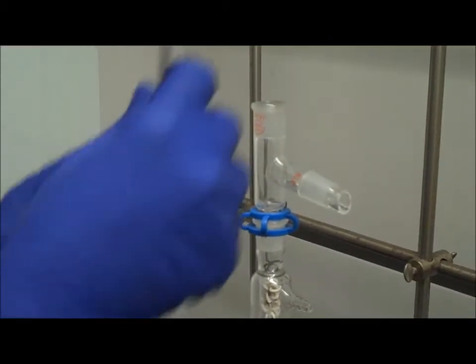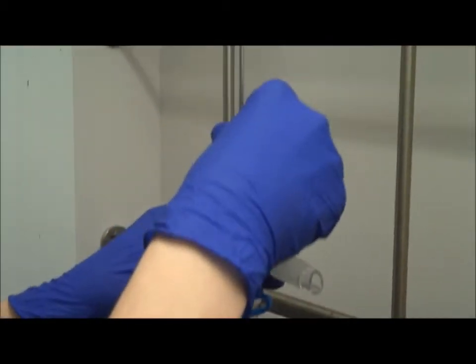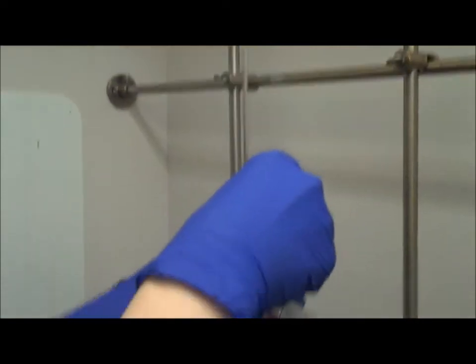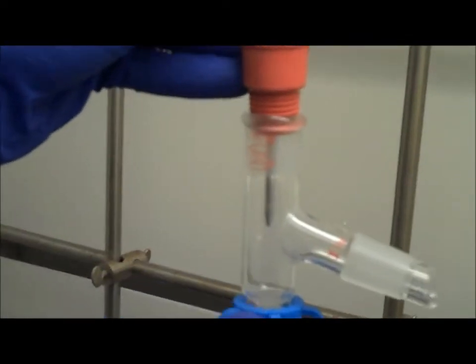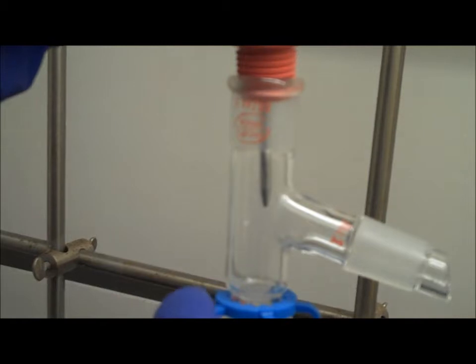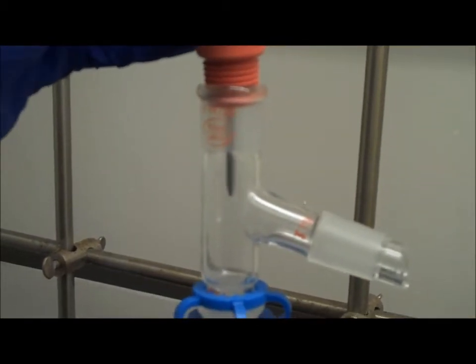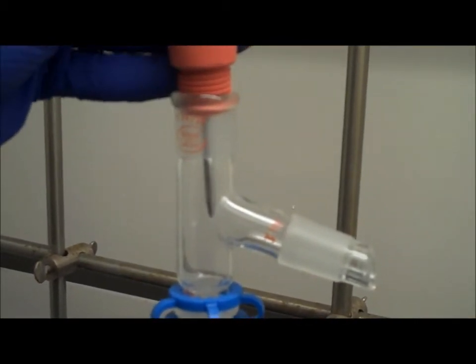In the top, you now place your thermometer through a rubber stopper. Please note the placement of the thermometer tip so you can monitor your temperature throughout the experiment as your distillate is distilled.